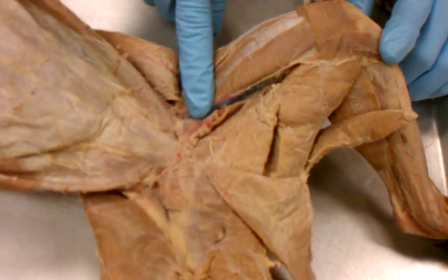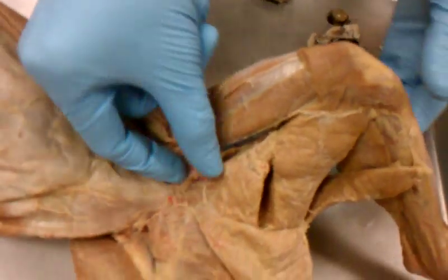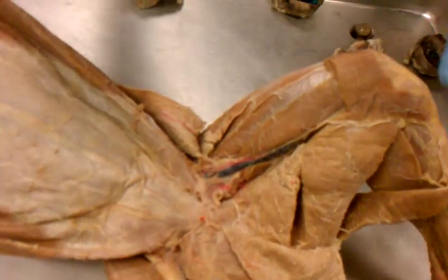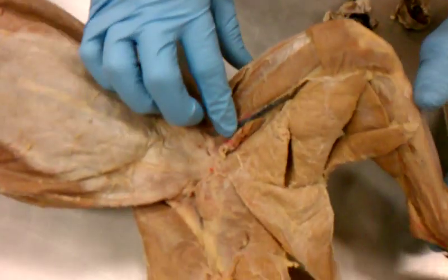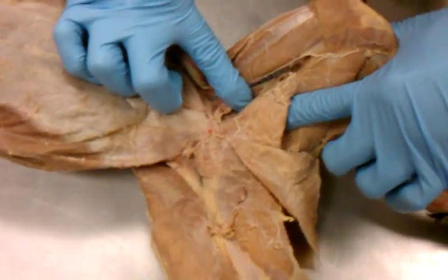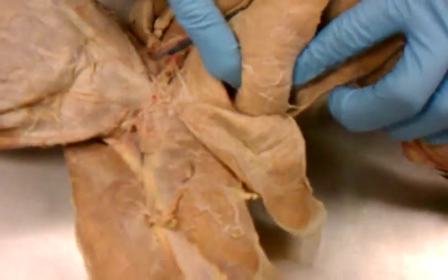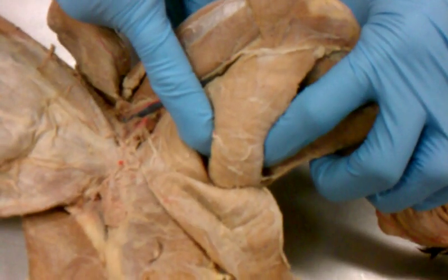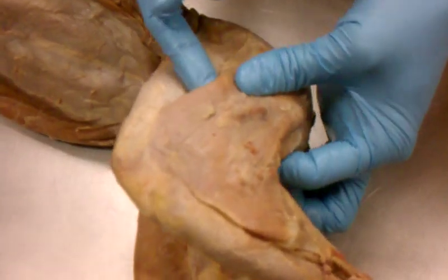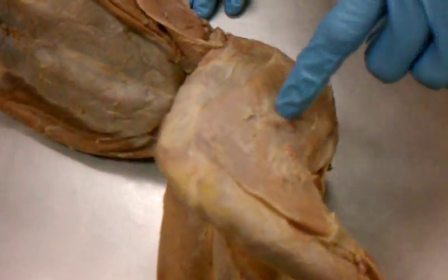So why is it called the adductor? Because it comes back in. So it pulls it towards the body. So if this were to get short and I pull on that, it should pull this towards the body. So it adducts the femoris. Then you have this triangular one. That's the semimembranosus. And then you have the semitendinosus on the side. And then this and all of this is your biceps femoris. And if your TA asks you that, they should pin it on this side.